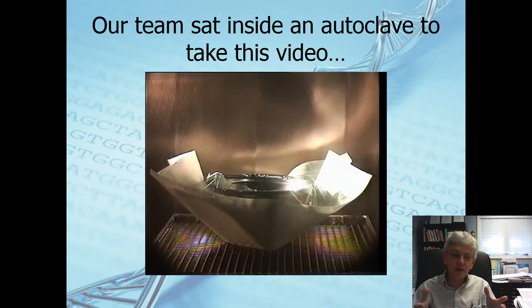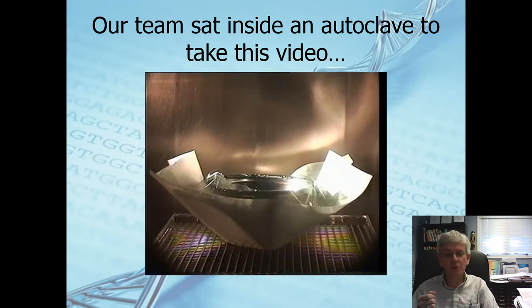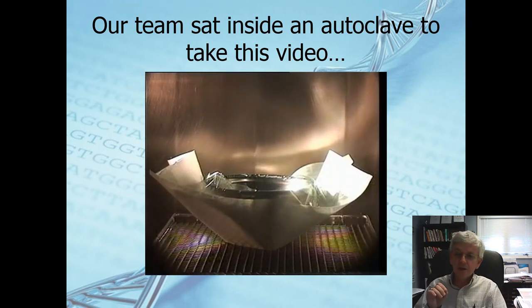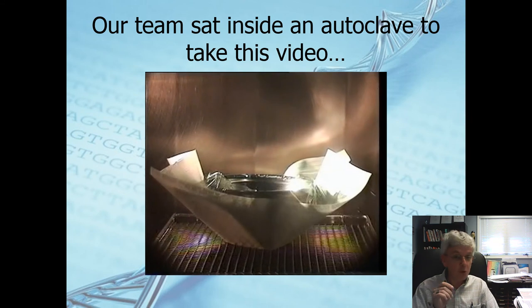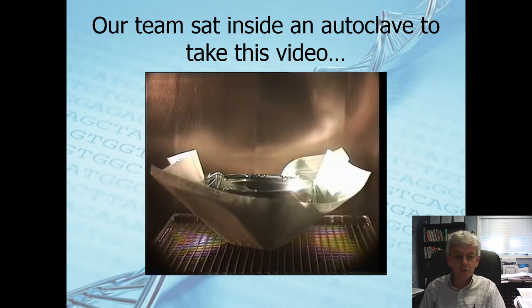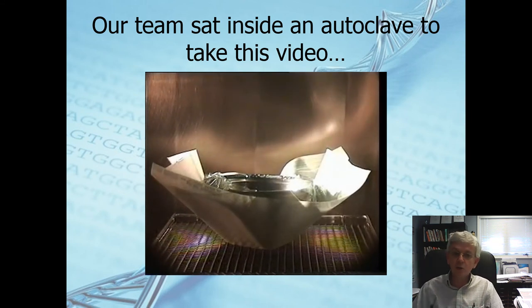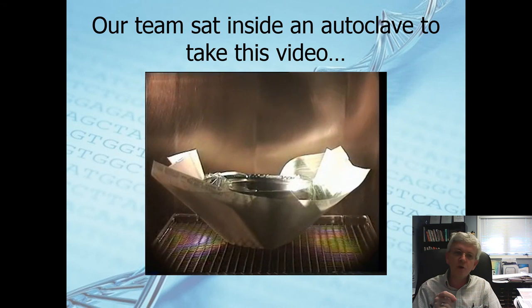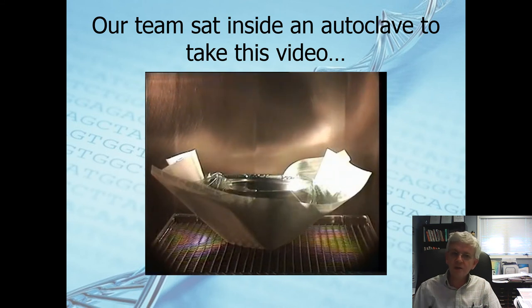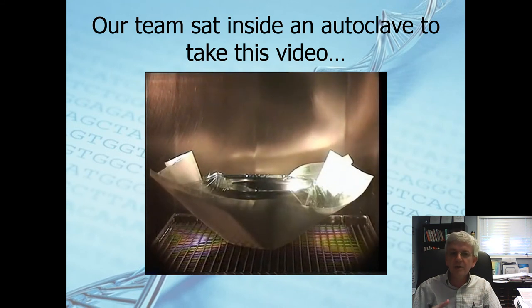No wonder these things come out and they're kind of crinkly and look brittle almost, because this stuff is going through a lot of cycles, a lot of abuse inside this autoclave. This is what things look like.